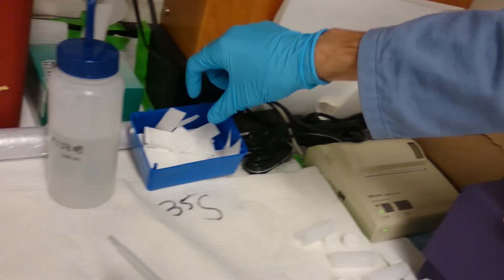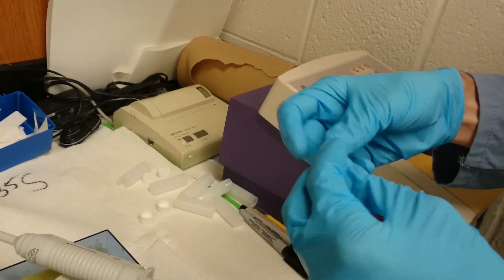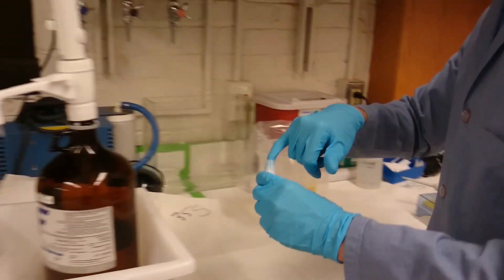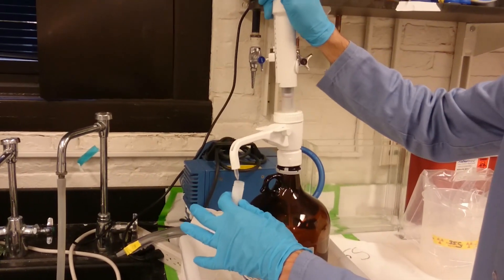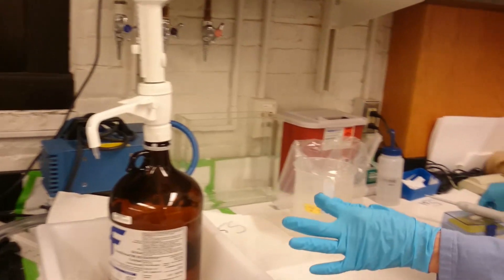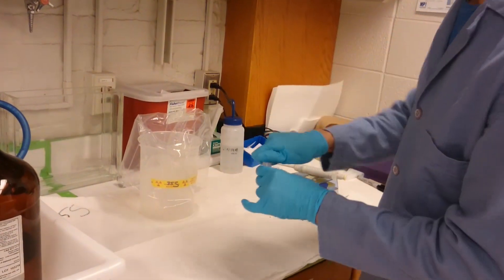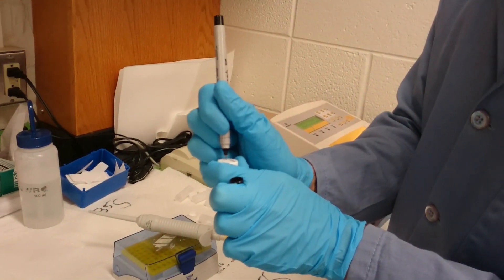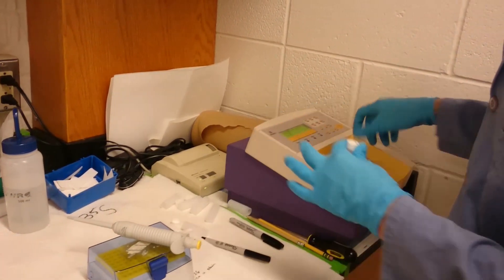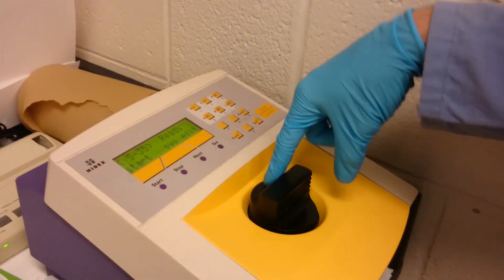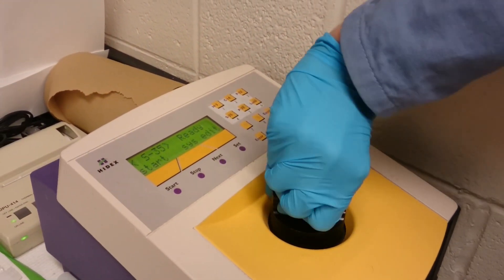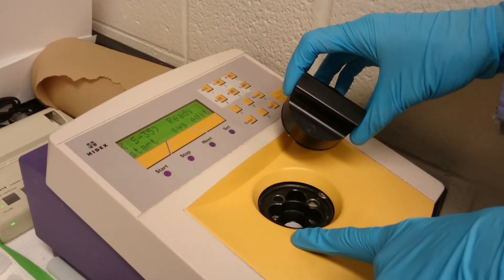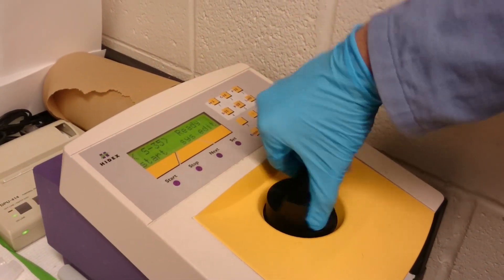The first thing that you'll do is start by taking a blank. So you take a swipe paper, put it inside the tube, fill it with six milliliters of scintillation fluid, cap it, mark it with a number as well as what it is so that you can remember. Then put it inside the machine. With this, there's a small dot here on the lid, and you have to push and turn until this circle is matched up. This is open and this is locked.